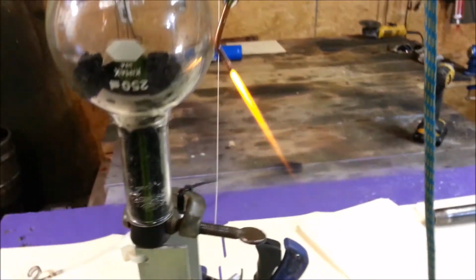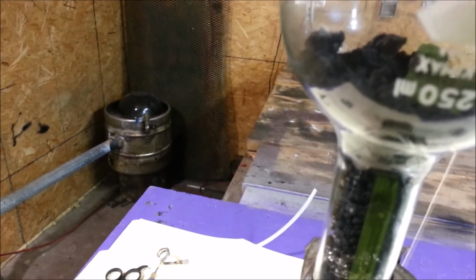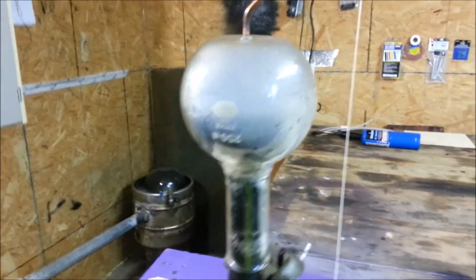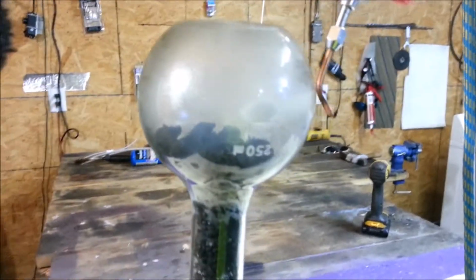And that's where we're at. Here goes. Gotta be quick. It's pretty cool. Uh-oh, I think it went out. I don't know what the heck happened there. It just went out for some reason. Well, we're stopping that test already.